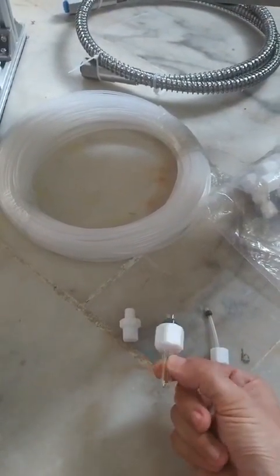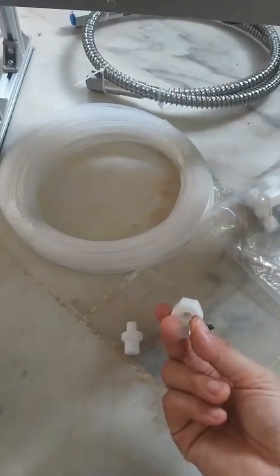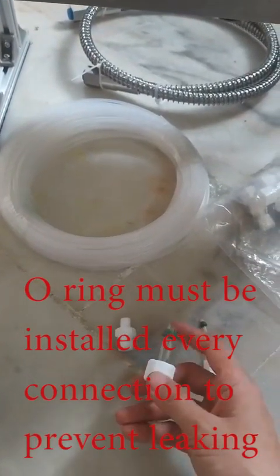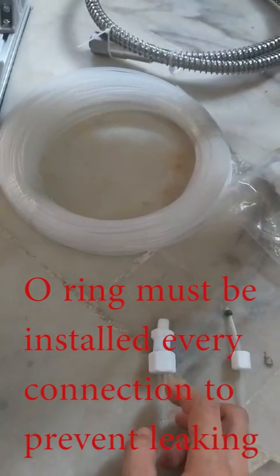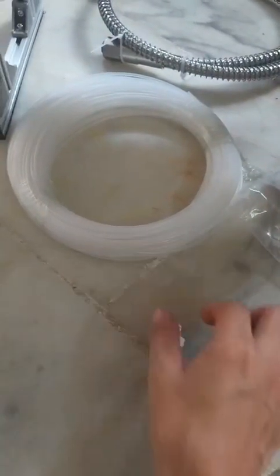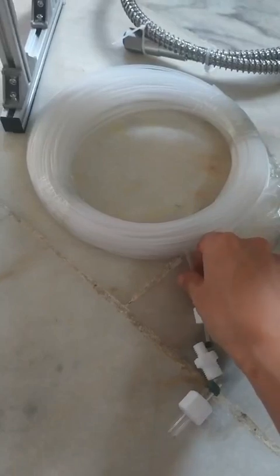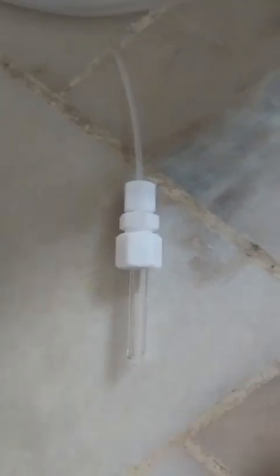This glass tube is the one you gave me for measuring the size. And you can see this Teflon device is specially made based on your size. So you install one of the O-rings to seal your glass device and screw it into this device. Then your glass device will be locked properly without leakage. On the other side, you use this O-ring to seal the flexible tube. At the same time, you screw it in, and you will get an adapted structure like this.